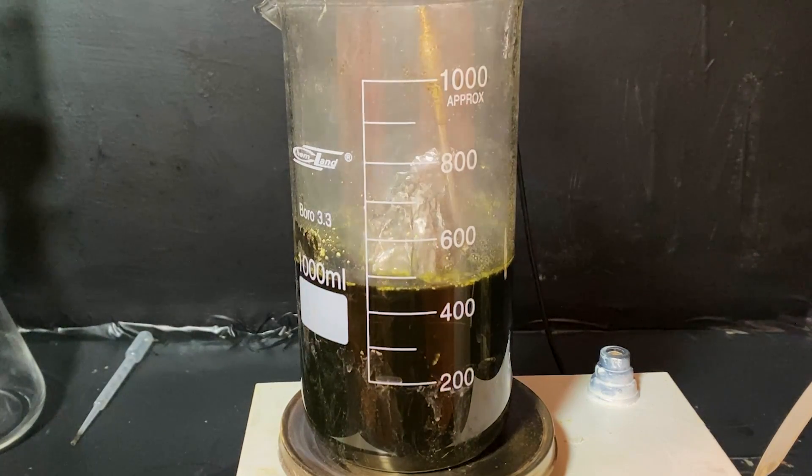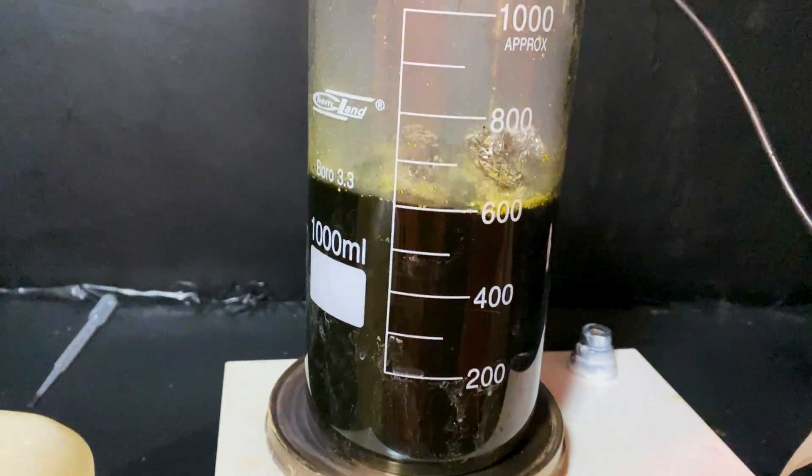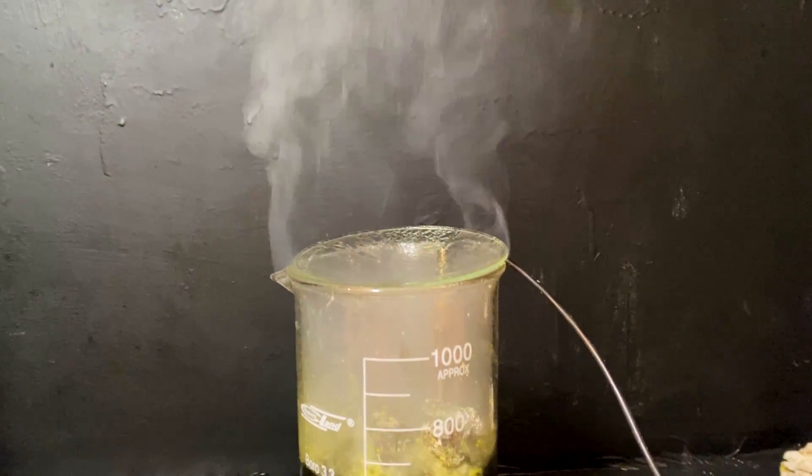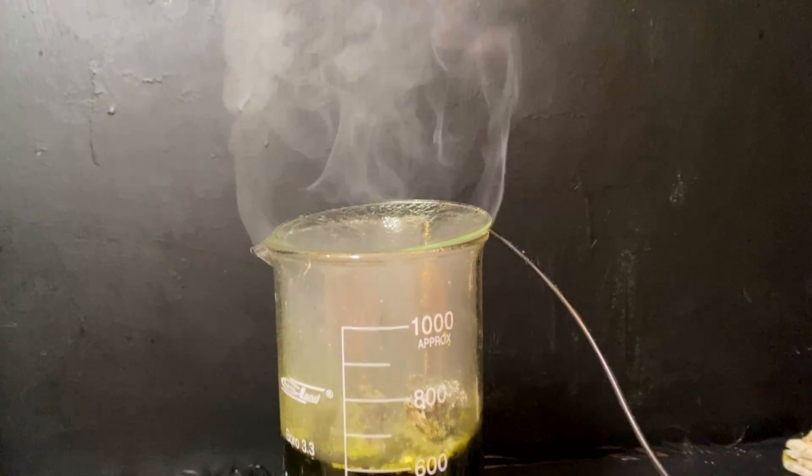The reaction is extremely exothermic. The water immediately turns into steam on contact with the aluminum. It got so bad, in fact, that when I've put the beaker with the mixture outside, condensed water was dripping from my fume hood pump.